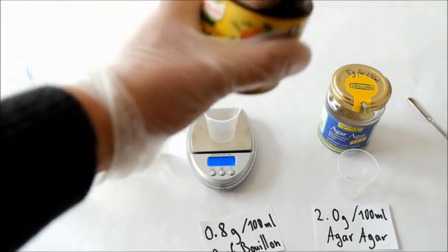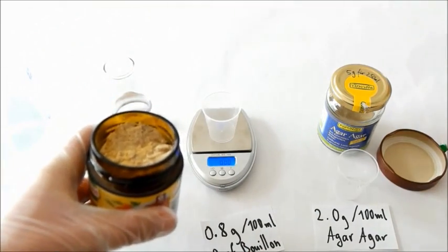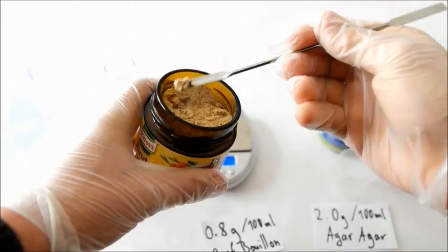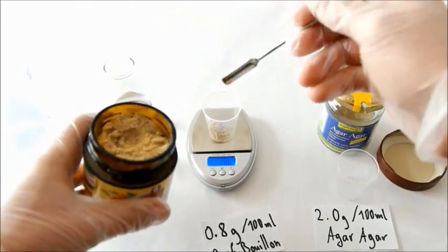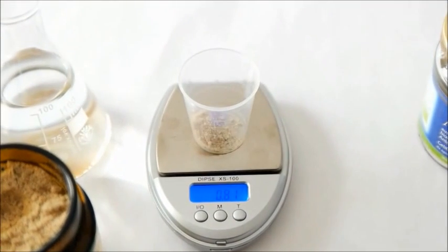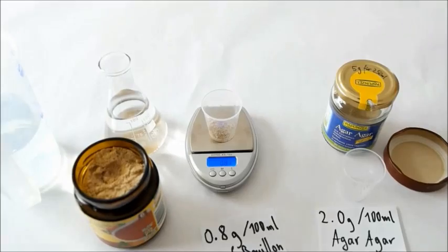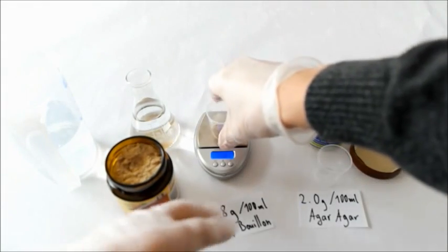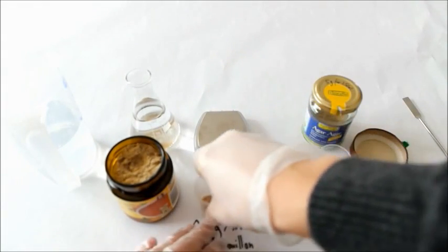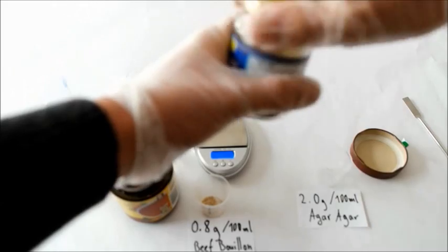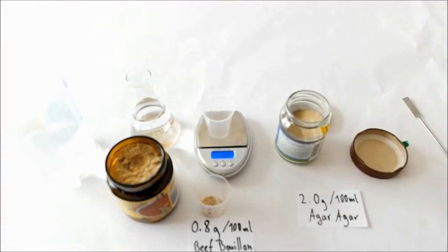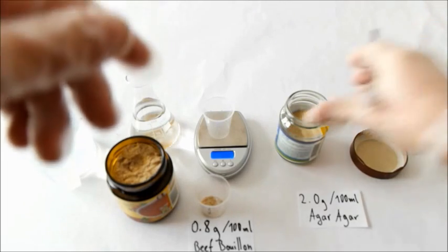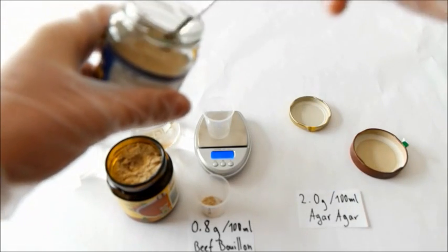So 0.8 grams. Now I am around 0.8 grams. And then 2 grams of agar agar.